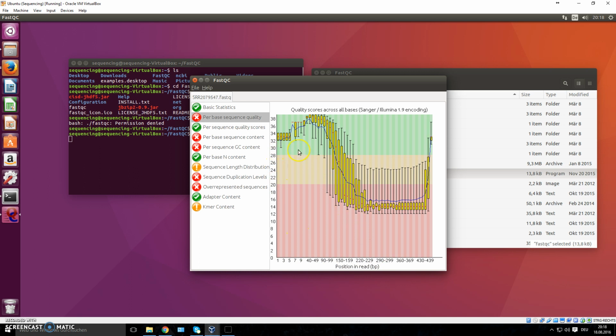And you can see with that they have neat green, yellow, orangish, and red bars right here where you can tell which area is my sequence and how well it is doing. So this particular file does not look good. It's not very good that almost already at the very beginning of the whole thing, the quality drops immensely and it already reaches the red area.